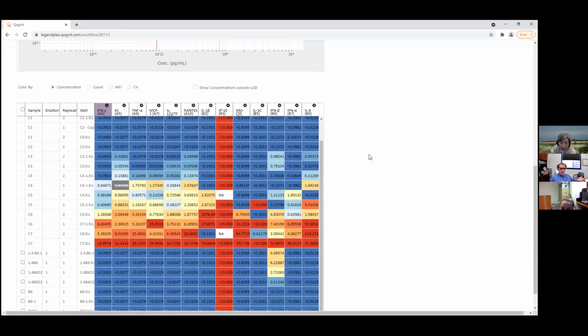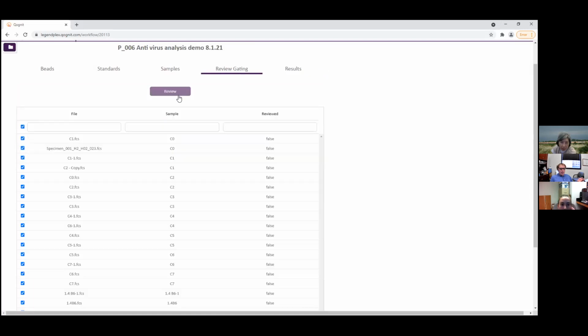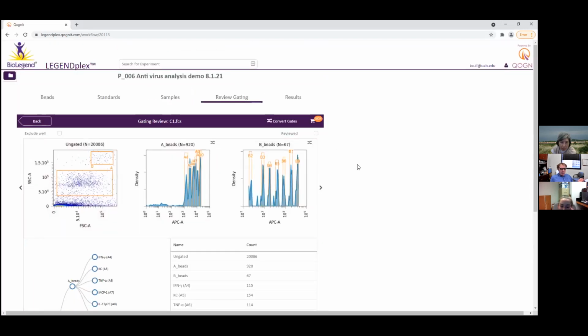We didn't know what to click on in their program to get to this, because I remember this was not there. Even their incorrectly identified peaks, we didn't see the first time. Last time I couldn't get the software to let me go to review gating. It would just go straight from samples, gate automatically, and give me results. I see. So how can you go to review gating?